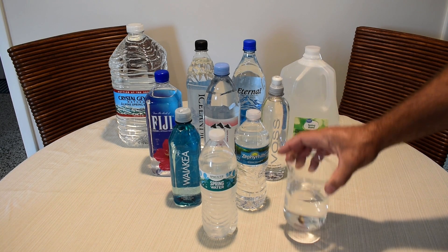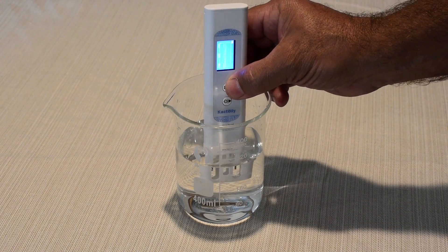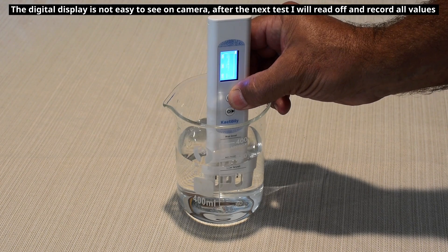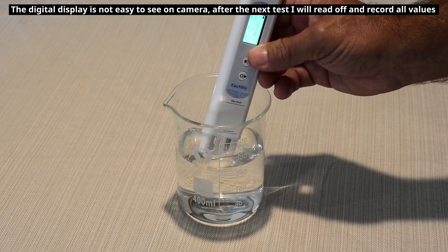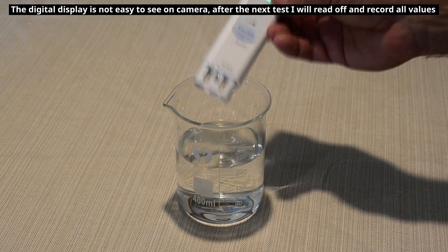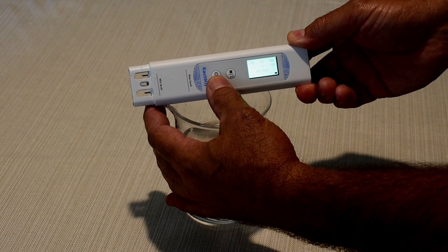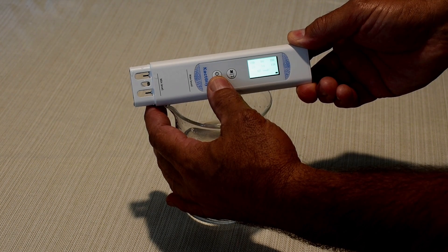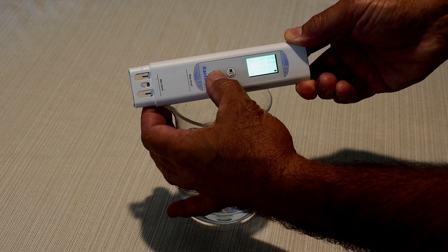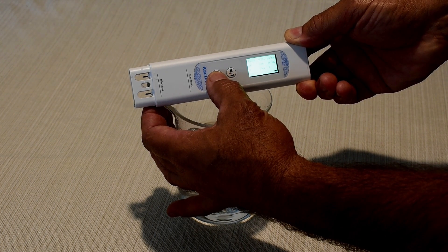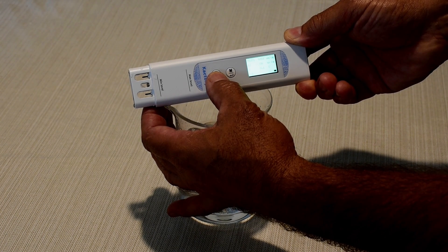Let's start using tap water from my faucet. Insert this into the water, push the button once, and I'm going to read you this. It says 80 good. Let's go over all the values. So right there it says COD 2.3, TOC 3.1, total dissolved solids 118, UV-275 is 0.031, conductivity 236, temperature 25.1.